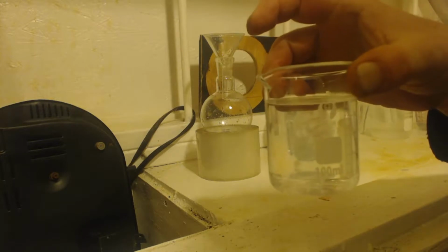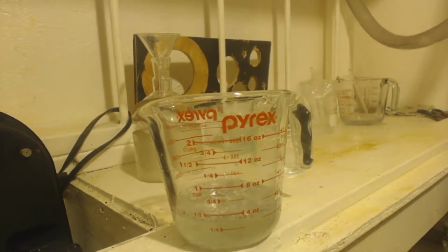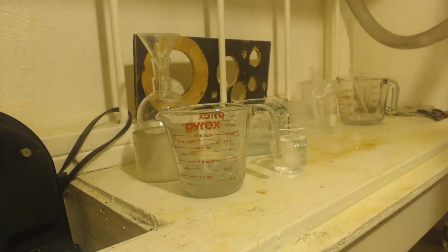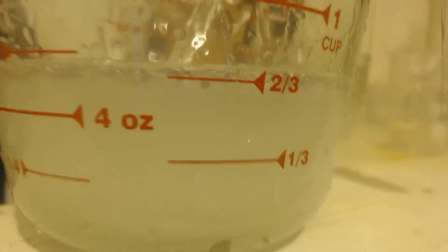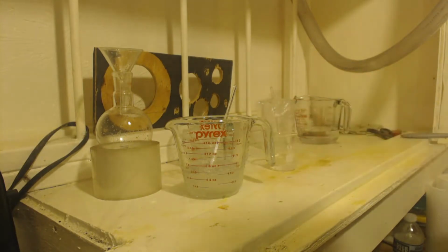Now this next third of a mole of HCl is for the crap that's in here. You can see metal, right? Other crap in there that the HCl will degrade. Keep in mind this does make hydrogen. Alright, I'm going to add the rest of this off camera, and then I'll get back with you. I'm going to pour this in.